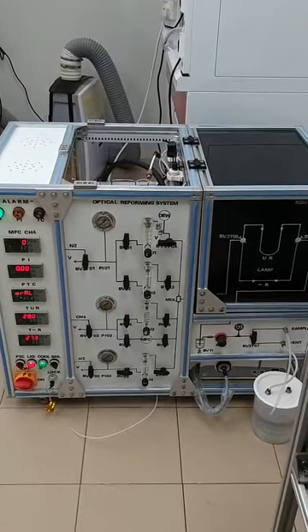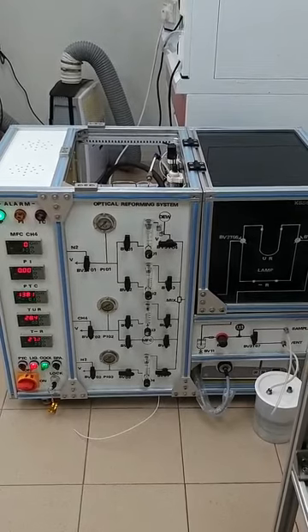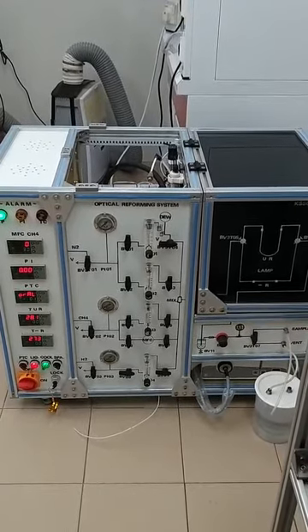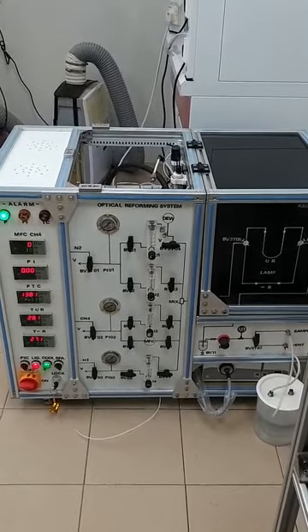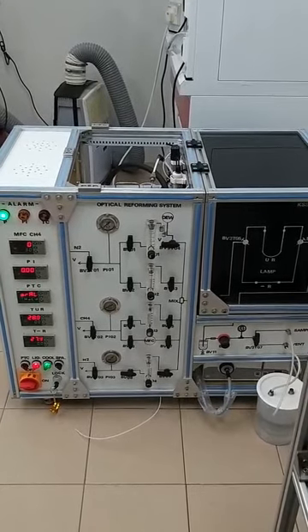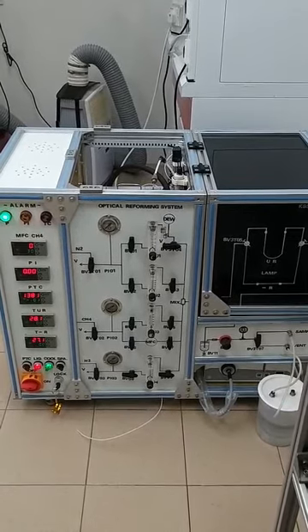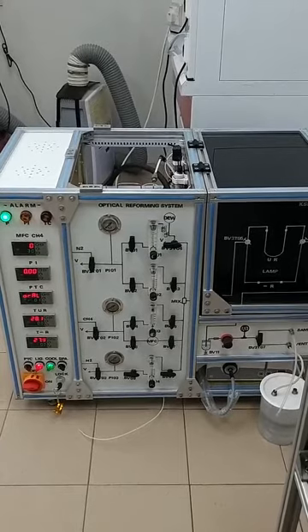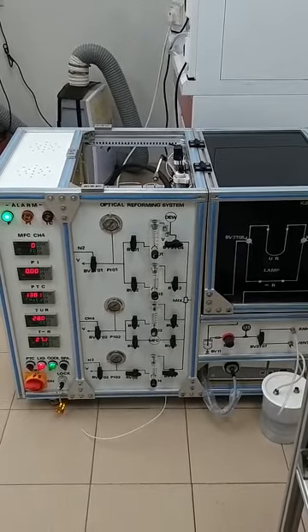First, we can see this instrument is designed with three lines. Three gas lines were installed with nitrogen, methane, and hydrogen. You can also change the gas to follow your experimental design. Nitrogen was used to remove the air inside the system, so you need to charge the nitrogen before you start the experiment.